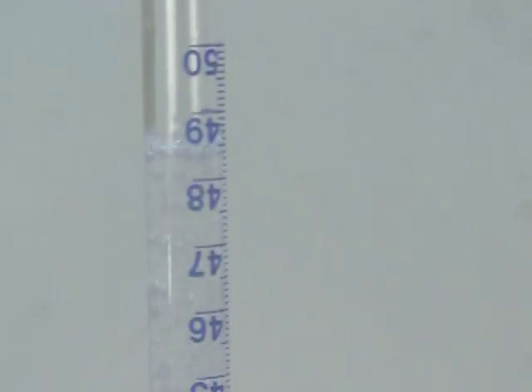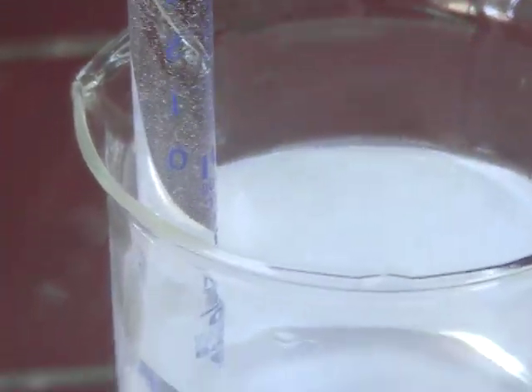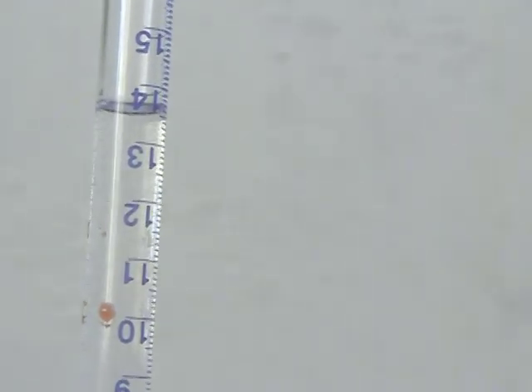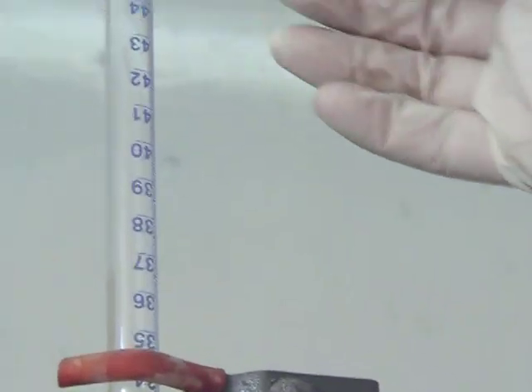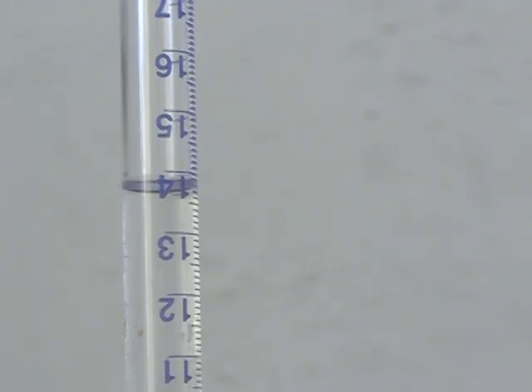It will start going down according to the reaction progress. When the reaction ceases, you determine the final volume. Determine your final volume - here we started around 50.2 or above the 50 and now it's around 14.2.